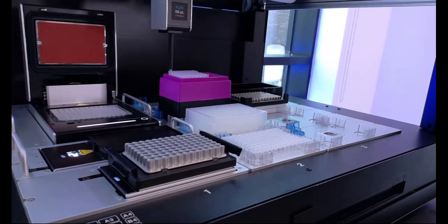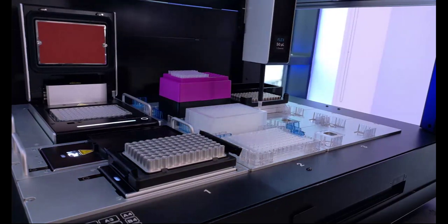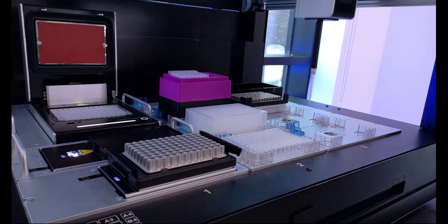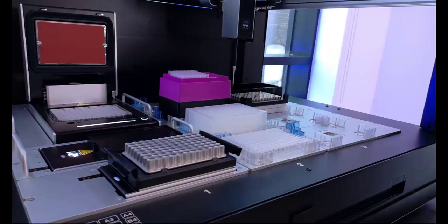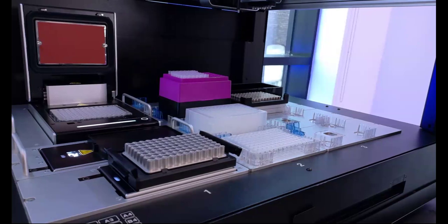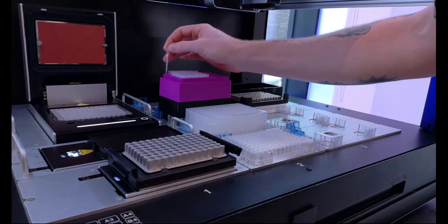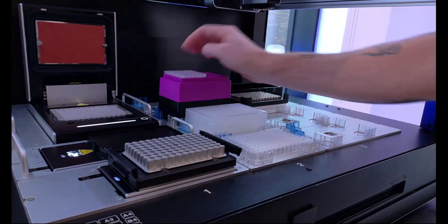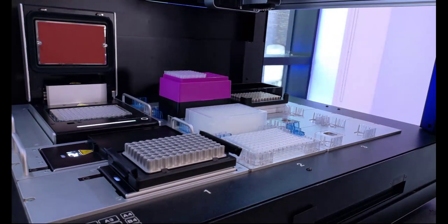Once this protocol finishes in a moment here, I will also show the functionality now that this CSV-based protocol has been uploaded to the robot. I have the ability to actually go in and specify the CSV using only a USB drive and only the touchscreen on the robot here. Okay, fantastic. I'm going to reload these tips quickly so that I don't run into that error totally accidentally again.